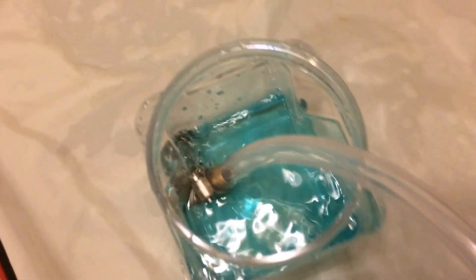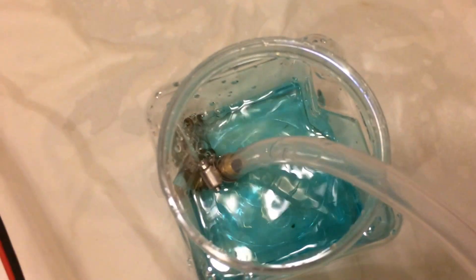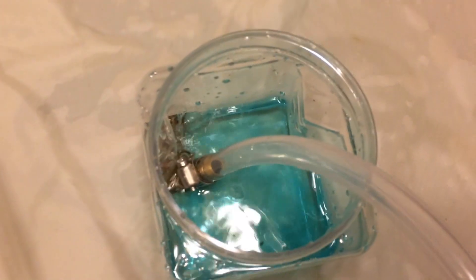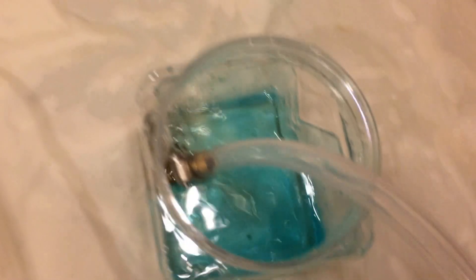Can you hold this a second? Just stand up. I got this. Just stand up and hold it over that. Starting to lighten up a little bit now. We're at one minute.